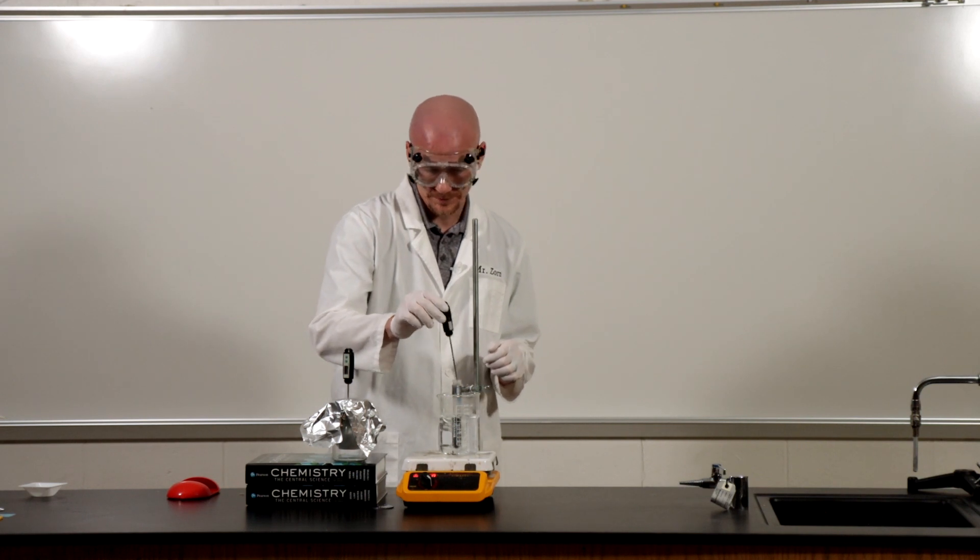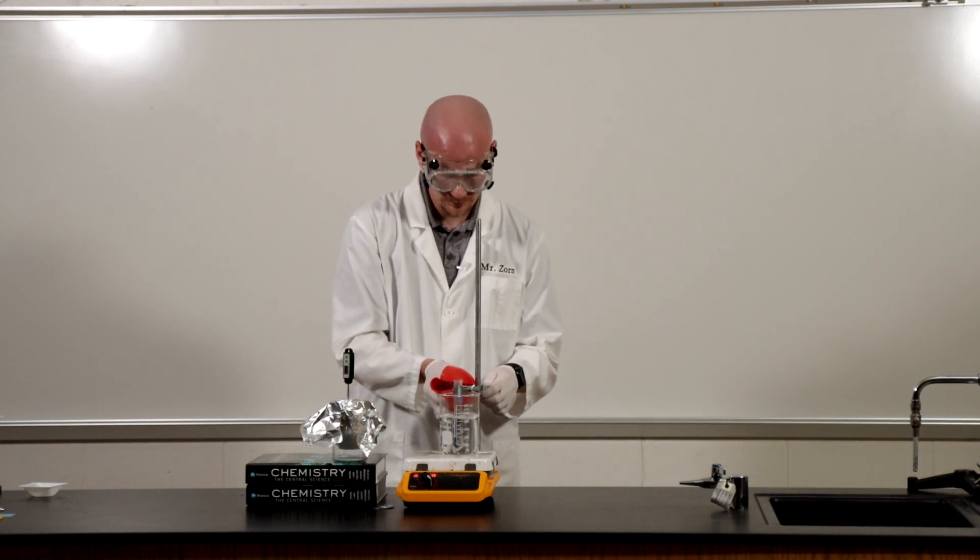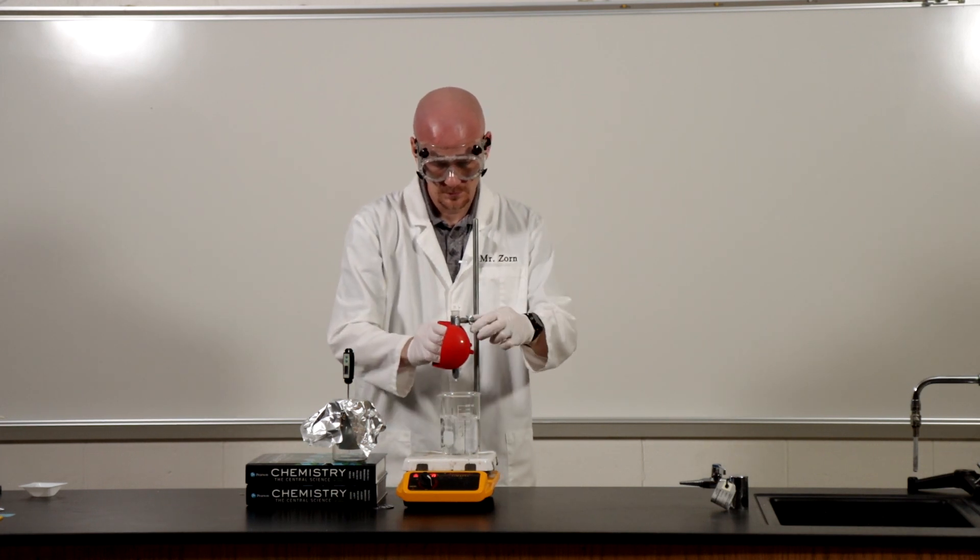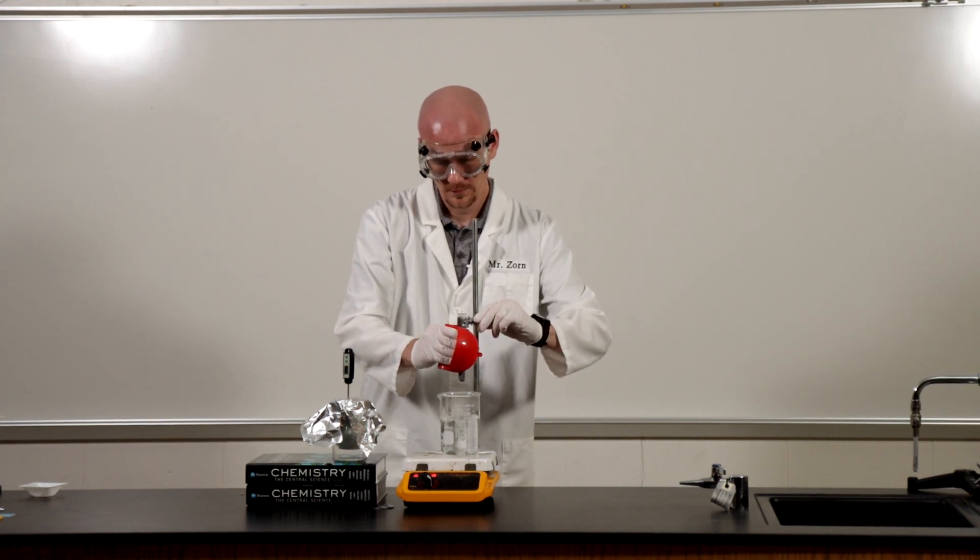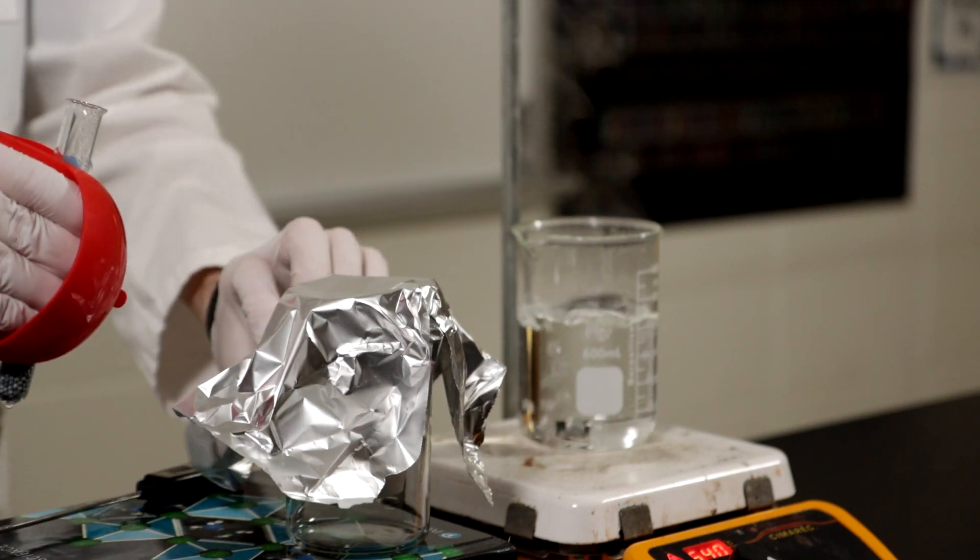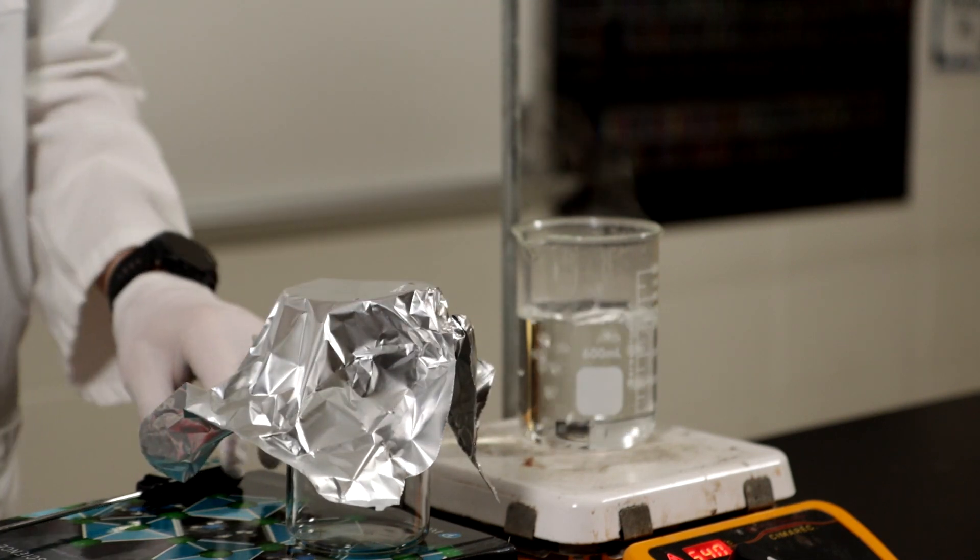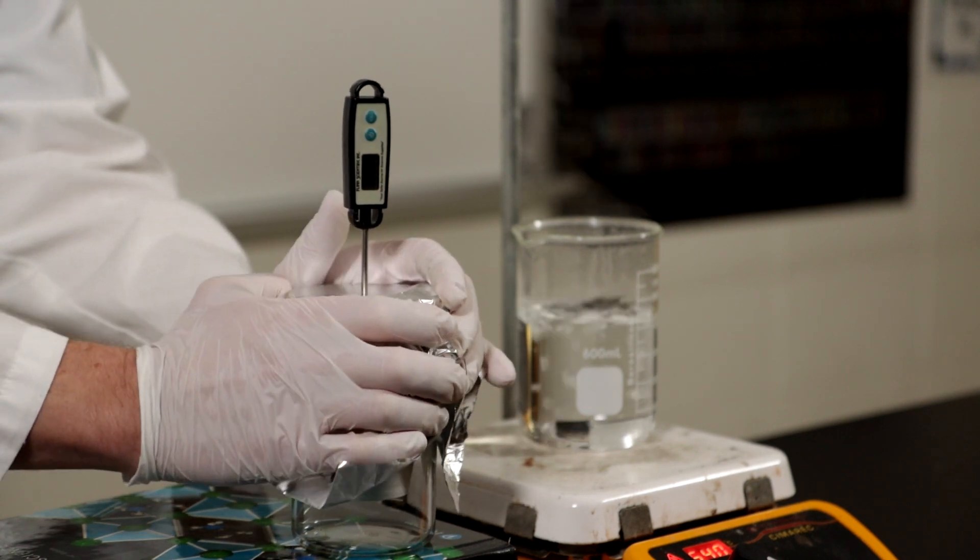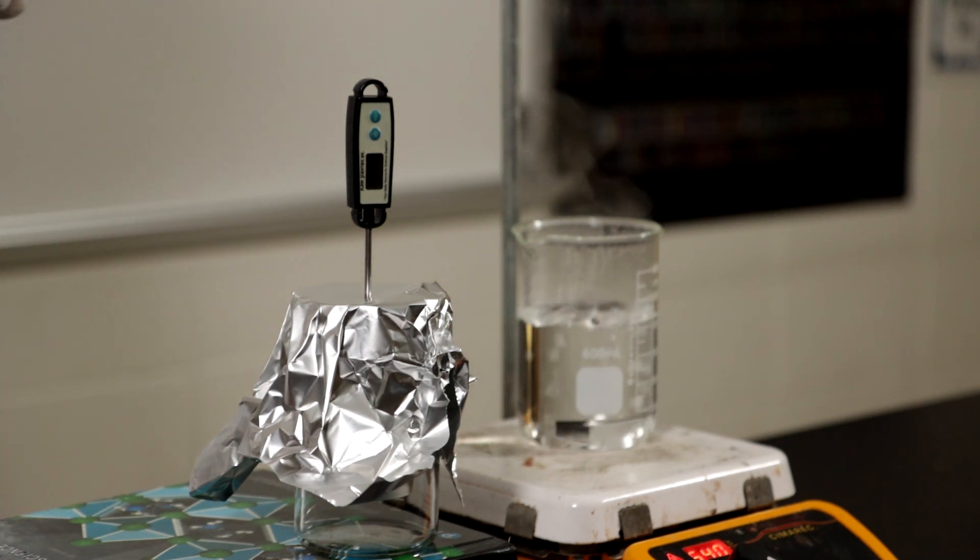Okay, so I'm going to be very careful here. Safety first. Good seal on that trying to limit how much heat escapes. So we're going to give this a couple minutes to stabilize and then we will take our final temperature reading.